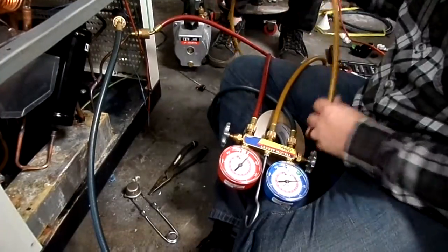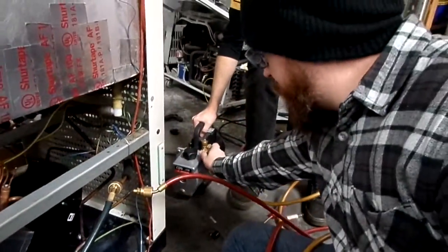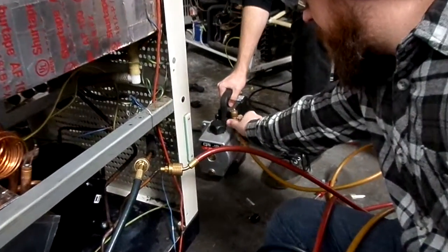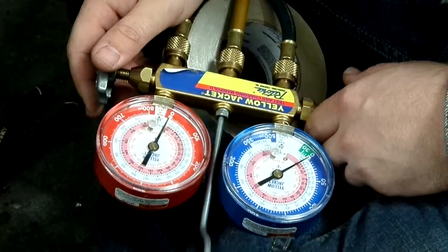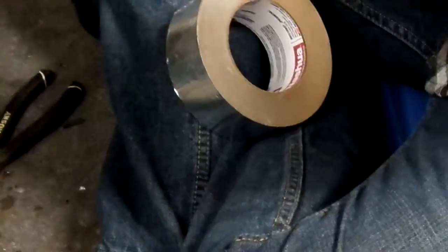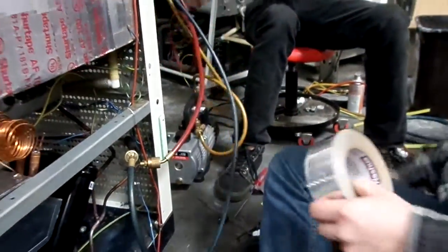Alright, so now we'll hook up our gauges to our vacuum pump. Once again. And Jesse will kindly turn it on. And then we'll just let that pull a vacuum while we do other things, such as wrapping this up. Yeah. Just sit them on anywhere.